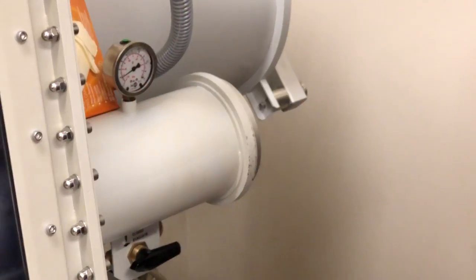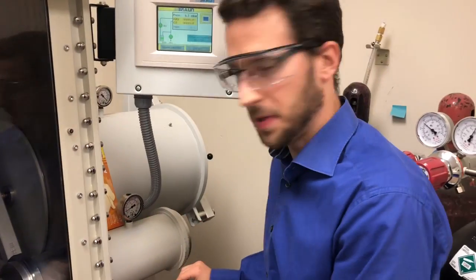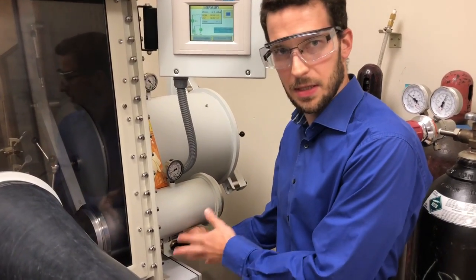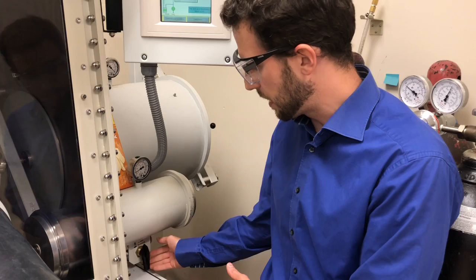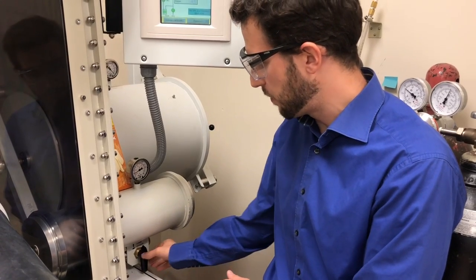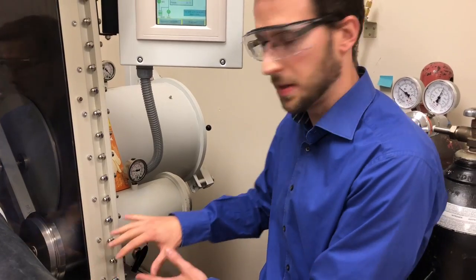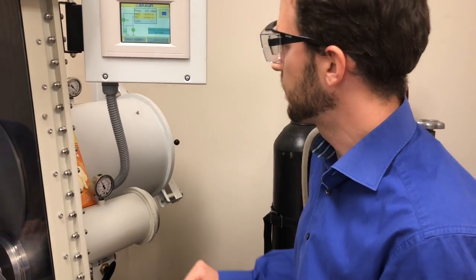Eleven minutes later — we waited 10 minutes and our stuff is properly evacuated. If you have a solid in an open bottle like right now, be mindful that after you turn it halfway, just open it slowly because the wind in there can throw it over.